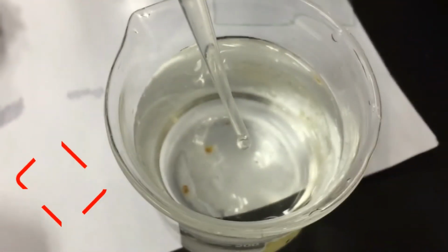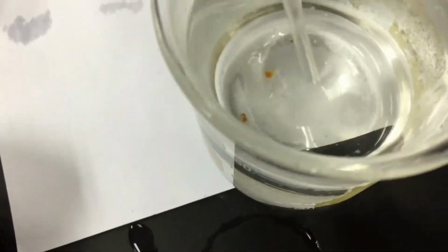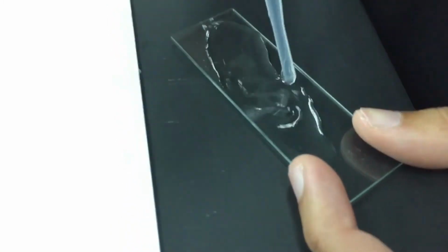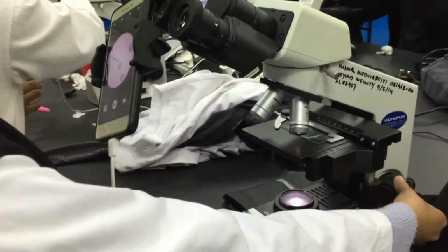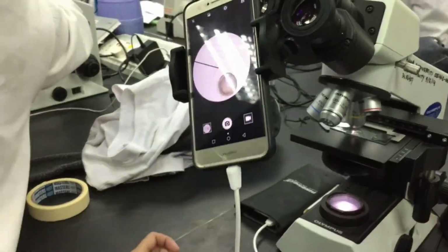After 5 to 6 hours, the eggs were obtained by scooping the eggs in the aquarium using a beaker. The eggs were transferred into the control and experimental condition. Only the transparent and floating eggs were chosen. A few drops of the eggs from the solution are added to a depression slide and covered with a cover slip. Excess water was removed using a tissue. The slide was observed under the microscope. The egg stages were observed from one cell until it hatched, for 24 hours.